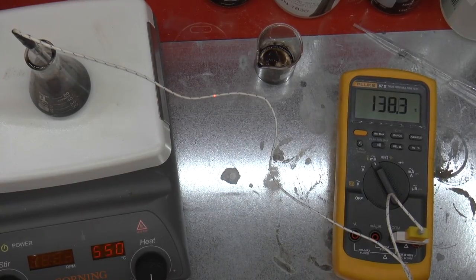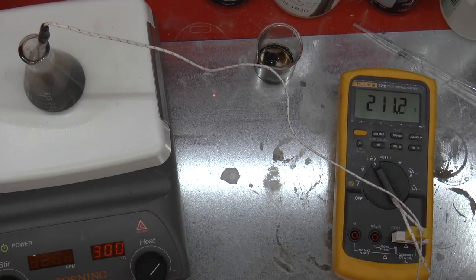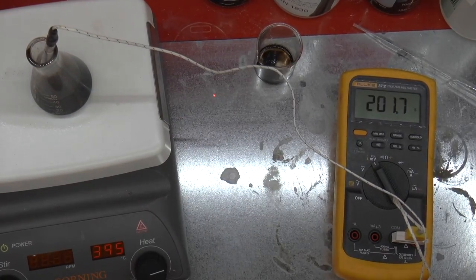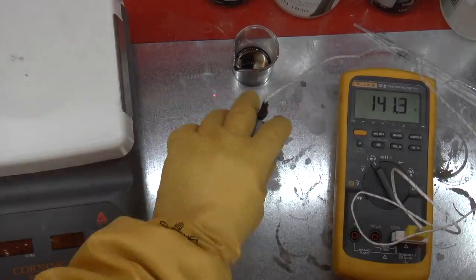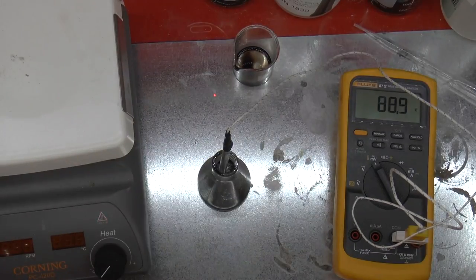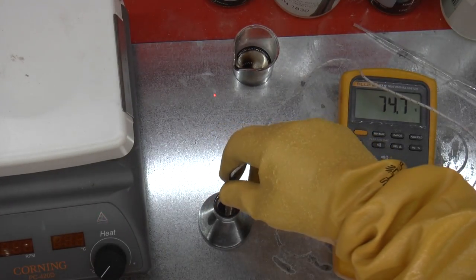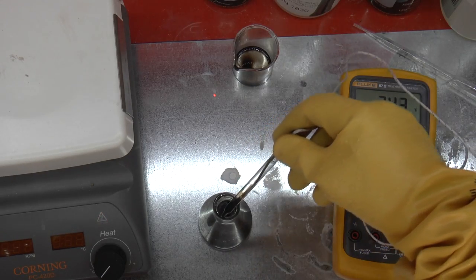Up to 200 C in about 14 minutes or so, and to cool down to about 75 or so takes another 7 or 8 minutes. All right, so let's see what we have.